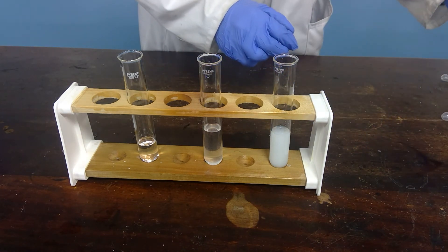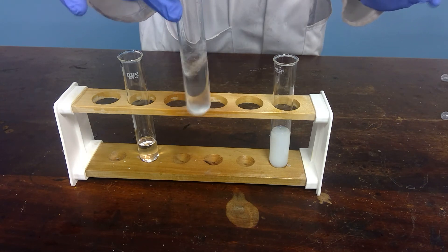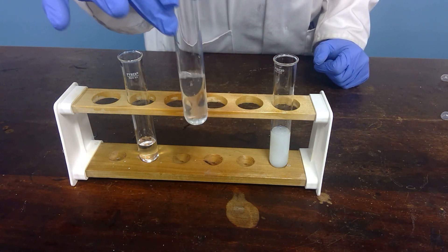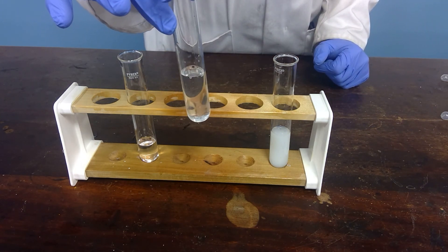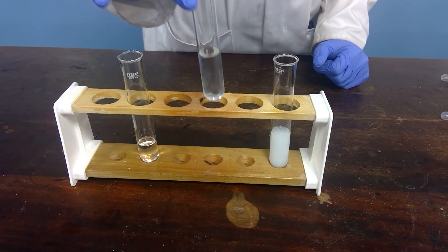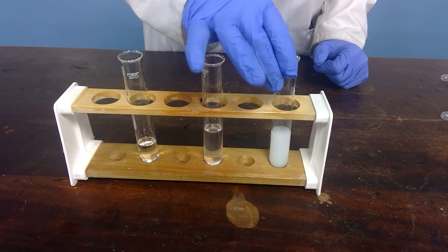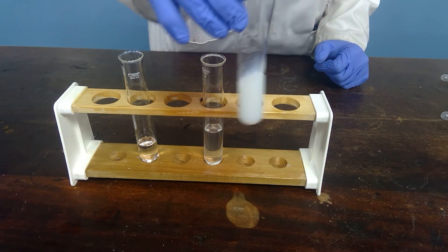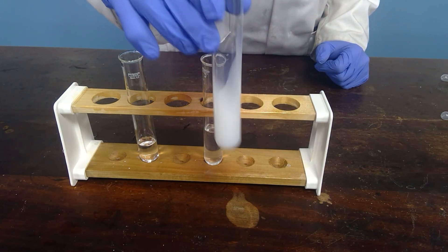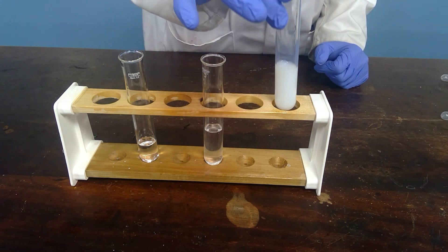And let's mix. You can see the bromide will definitely dissolve into concentrated ammonia, although it didn't into the dilute. And the iodide shows no sign of dissolving.